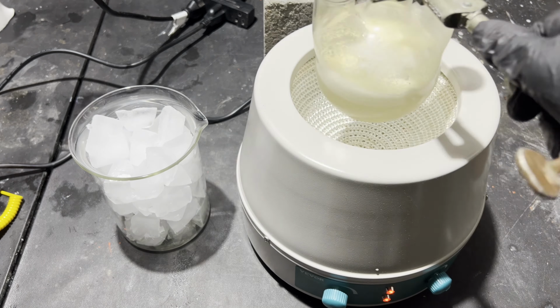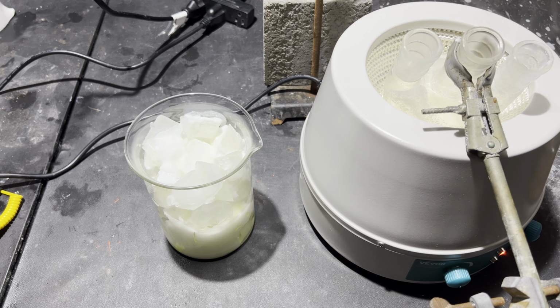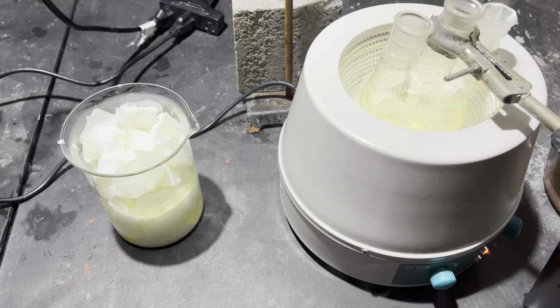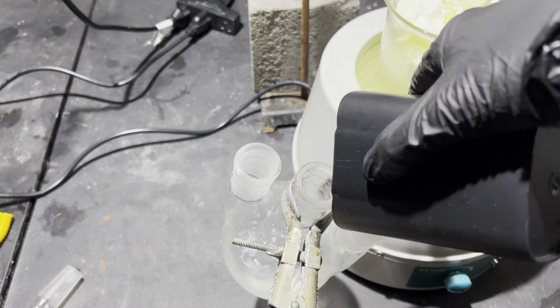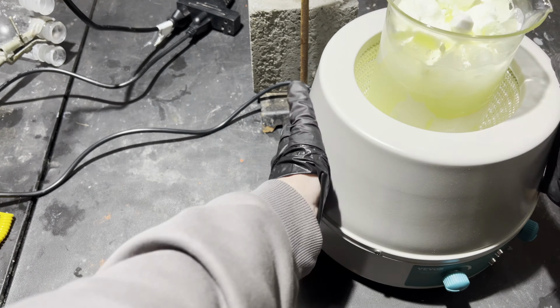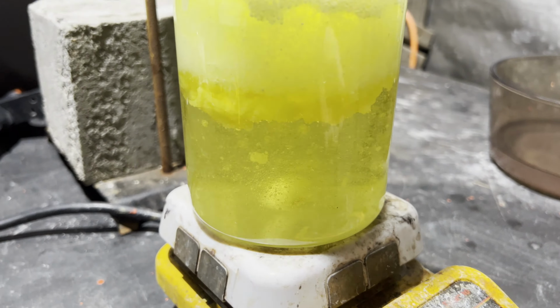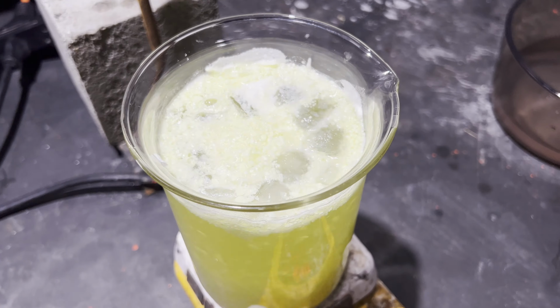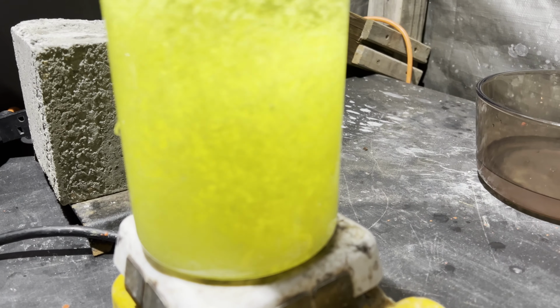I waited for it to cool and the top layer of nitrobenzoic acid solidified, sealing in the bottom layer of some combination of sulfuric acid, nitric acid, potassium bisulfate, and maybe potassium sulfate. I had to reheat it to be able to pour it onto the ice, and I just used the amount of ice that would fit in a 1-liter beaker. Not nearly as much heat was evolved as when the previous reaction mixtures were poured onto the ice, so I had to heat it up on a hot plate.